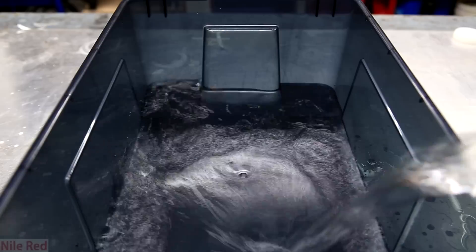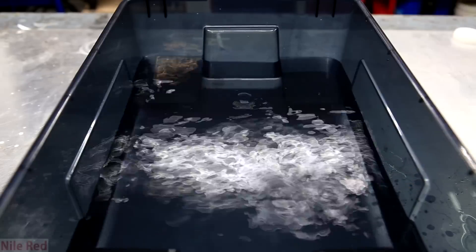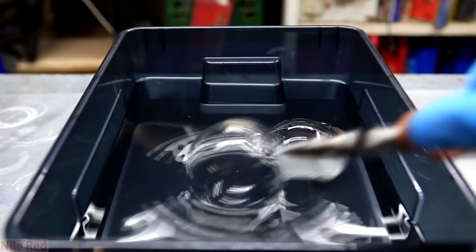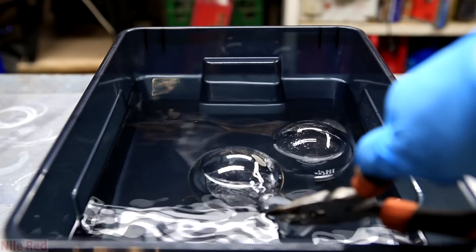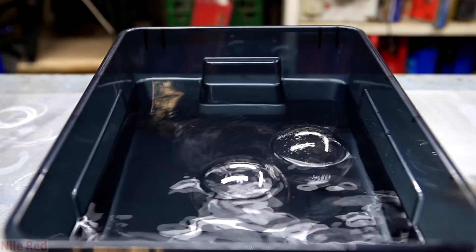With different types of salts and compounds, water or another solvent will not remove it, and even scrubbing has a very difficult time. This is extremely problematic when you're trying to clean something like a round bottom flask where it's actually very difficult to scrub the inside at all.